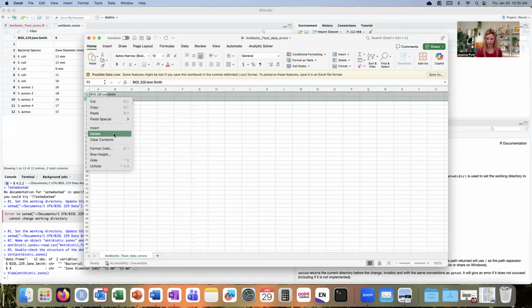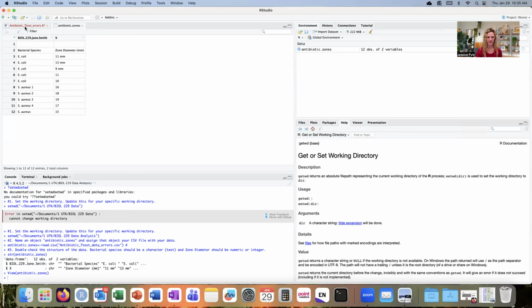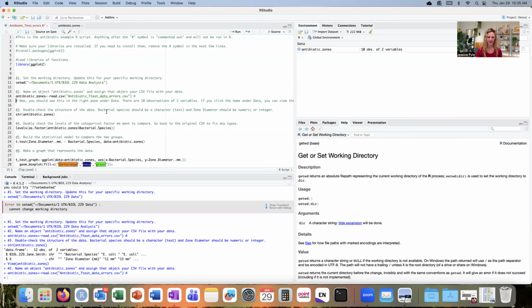There's also that empty row number 2, which was imported as an empty row into R as well. So I'll delete those 2. Now I have bacterial species and zone diameter, and both of them are in row 1. So I'm going to make sure that I save this file. And after I save it, I'll come back to R, back to my code file, and now I need to recreate that object by reading my CSV. So I'll go back to line 14 and hit Command Enter. Okay, now I've read in my new object.